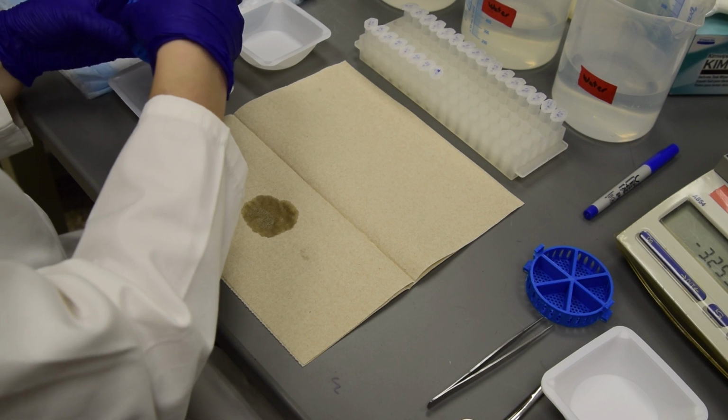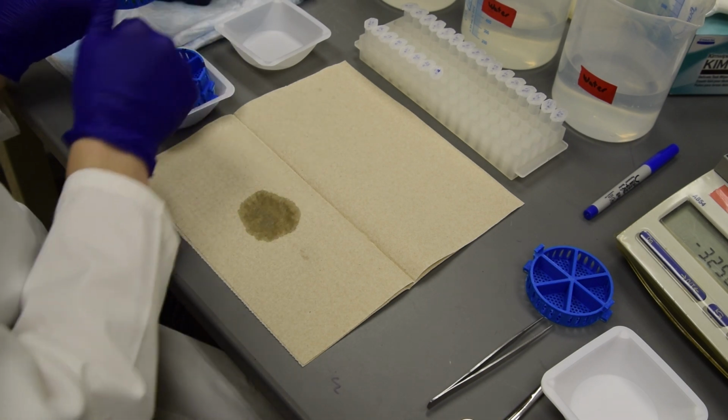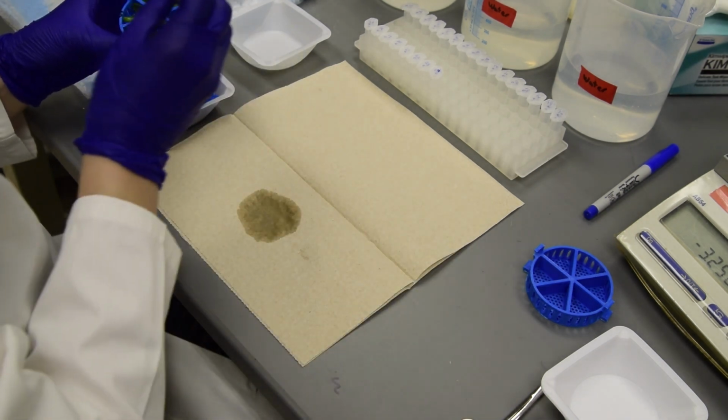Place the cylinder stack on the balance and remove leaves from the slots onto a sterile towel, keeping the leaves matched by sample.